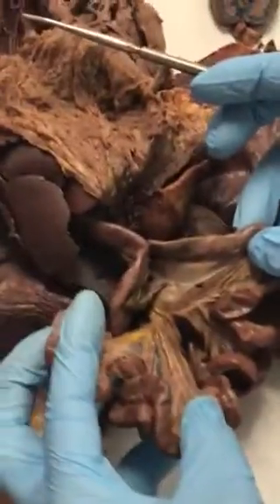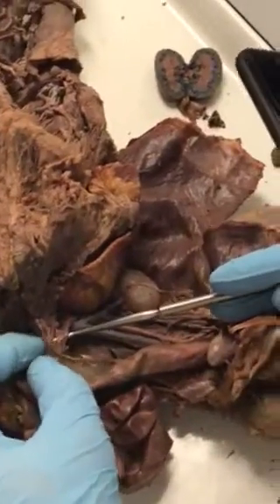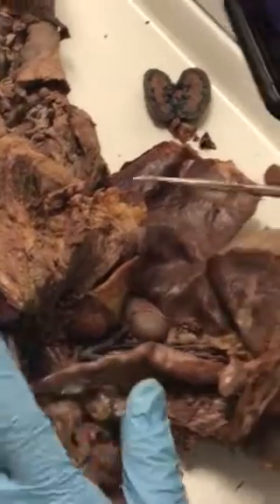And then if you look at our small intestines, we get this membrane in here, and that is called the mesentery proper. And then the mesentery proper connects up to our circulatory system right there at the anterior mesenteric artery. I think that's all of it.